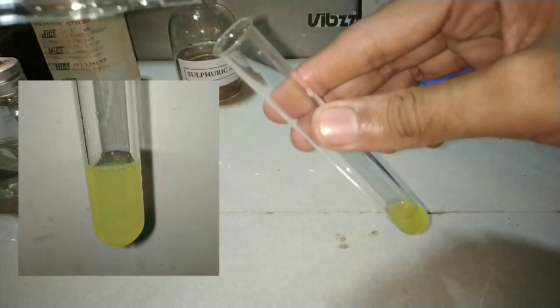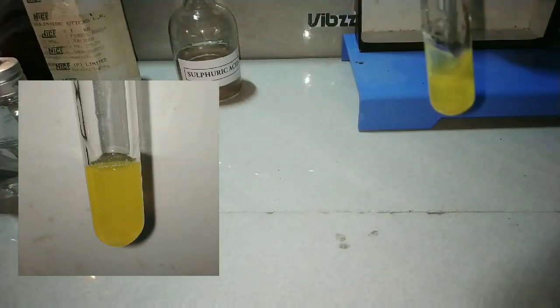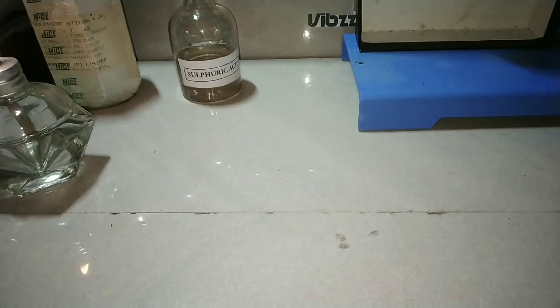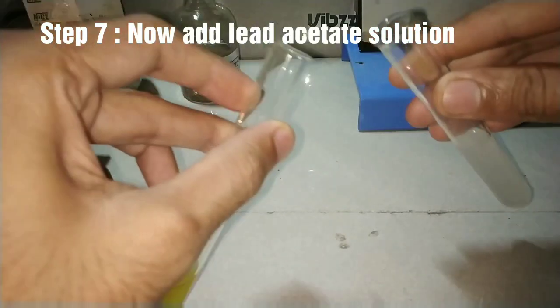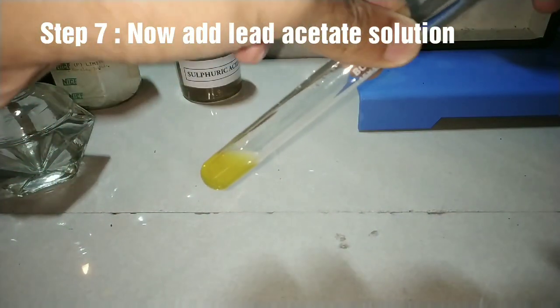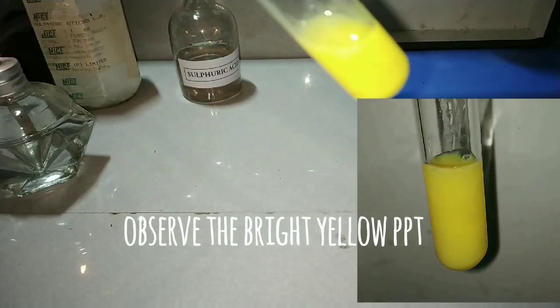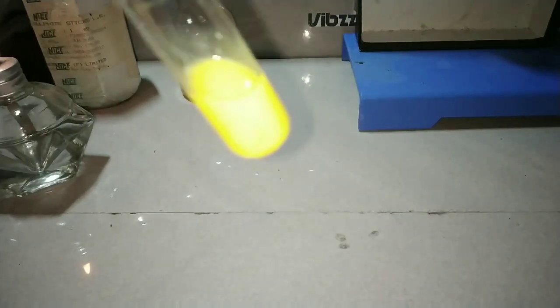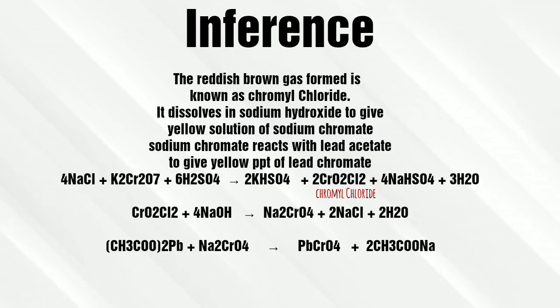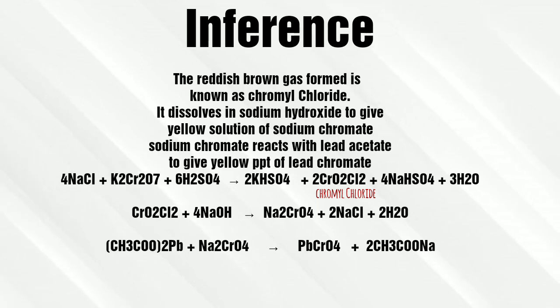Now take this yellow solution and acidify it by adding dilute acetic acid. The last step of the chromyl chloride test is to add lead acetate solution into this acidified solution. You can observe a bright yellow precipitate. The reddish-brown gas was chromyl chloride, which reacted with sodium hydroxide to produce sodium chromate, which in turn reacted with lead acetate to produce lead chromate — the yellow precipitate.